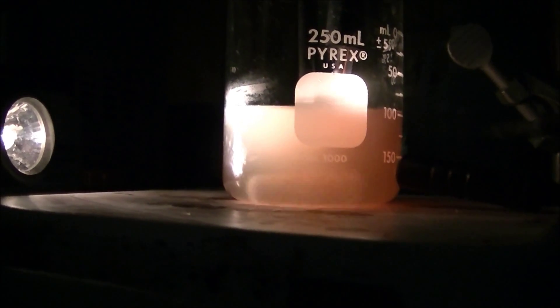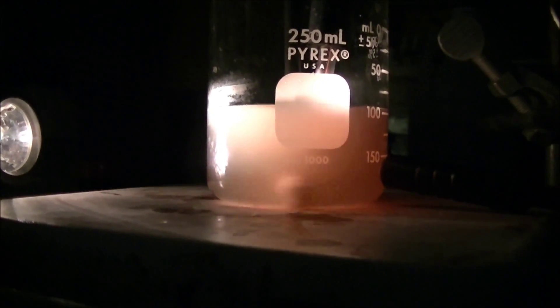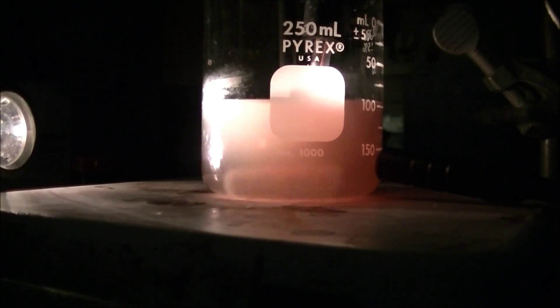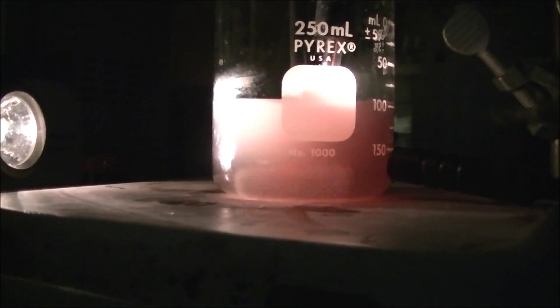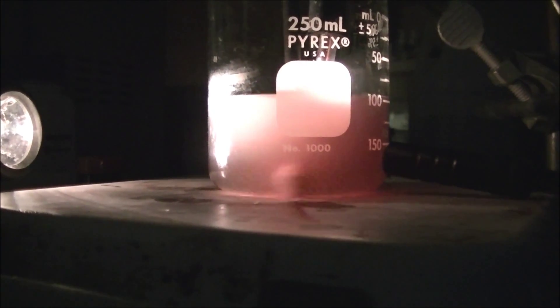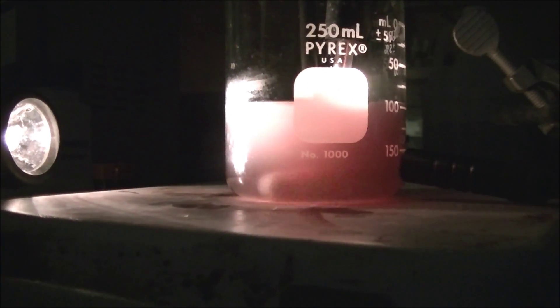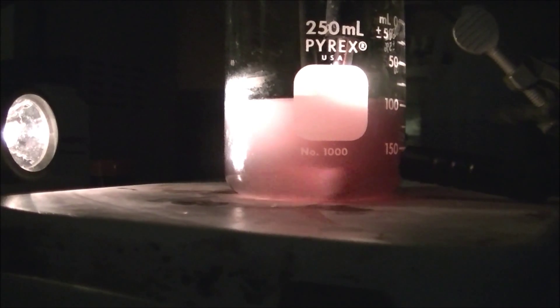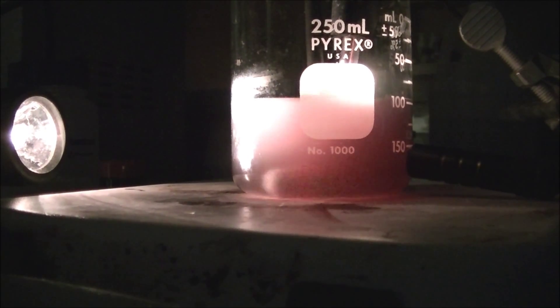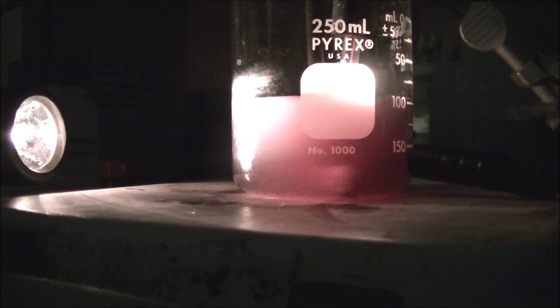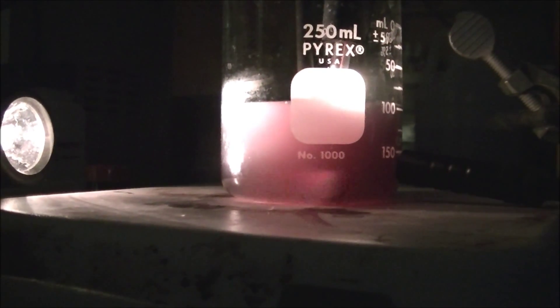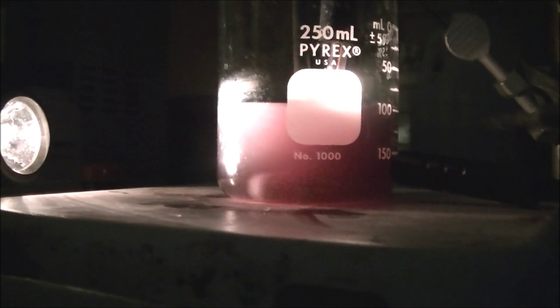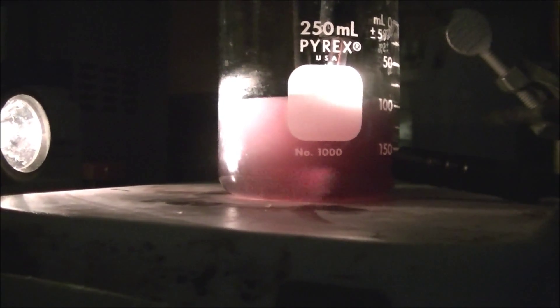I am not sure if you can see it, but it's starting to get a little darker in there. So that corresponds to this point right now. It corresponds with the drop of the light that you can see on your graph. And we know that now, since it's a lot darker, that all the ascorbic acid has been reacted and the iodine is reacting with the starch to create this blue-blackish color. I'll turn on the lights and you'll be able to see it a lot more clearly. The difference is pretty obvious, hard to miss.